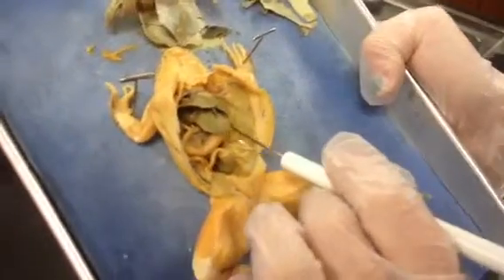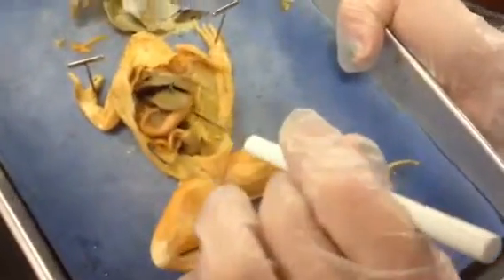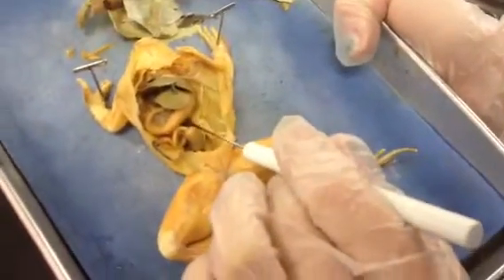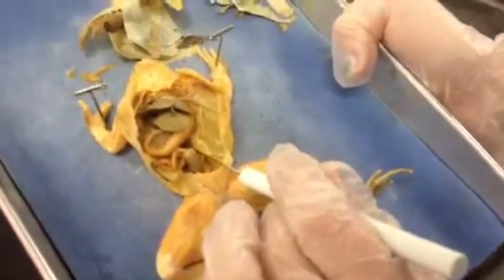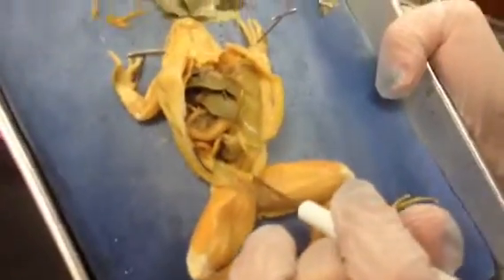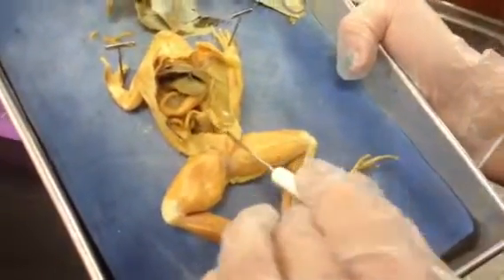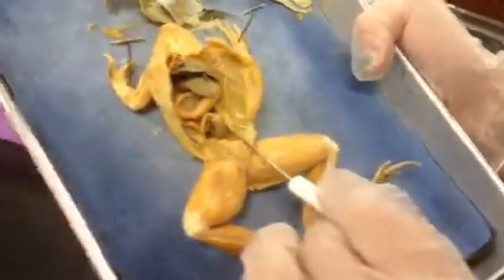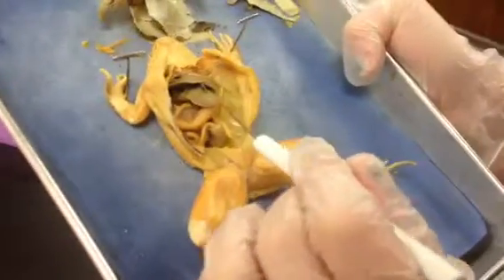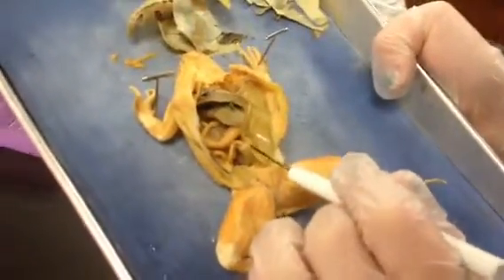More fat bodies. The kidney is right there. The cloaca is right here. The ureter is right here.